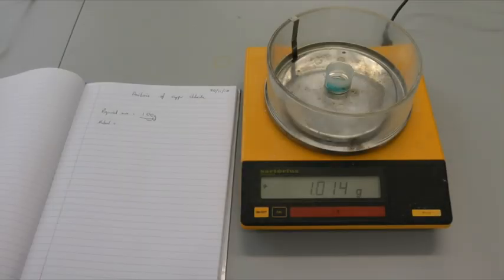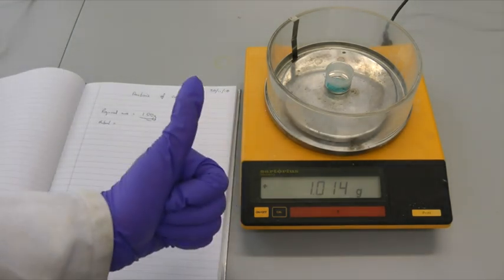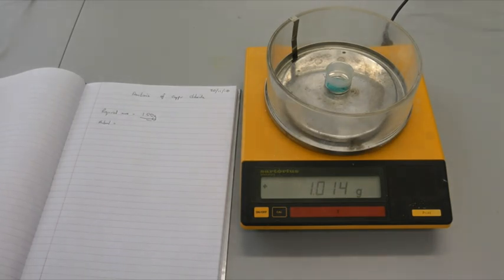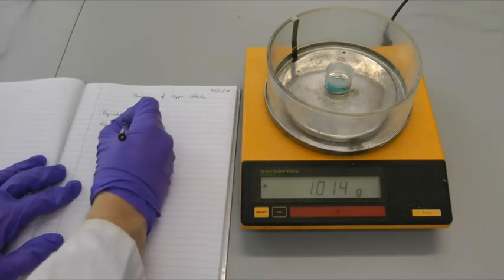Some experimental procedures say something like, accurately weigh out approximately 10 grams of material. This means that you don't have to weigh out exactly 10 grams, but you should weigh out an amount that is close to 10 grams and you should record the mass that you've got accurately.